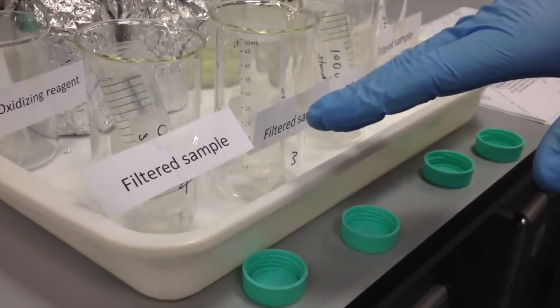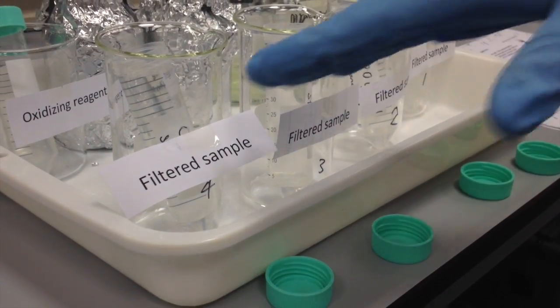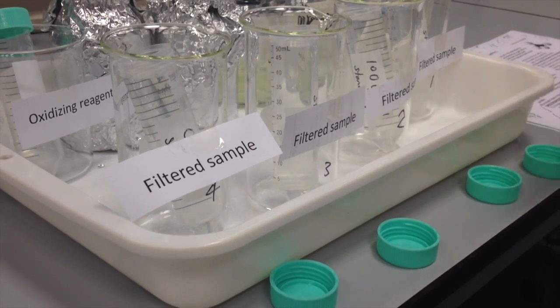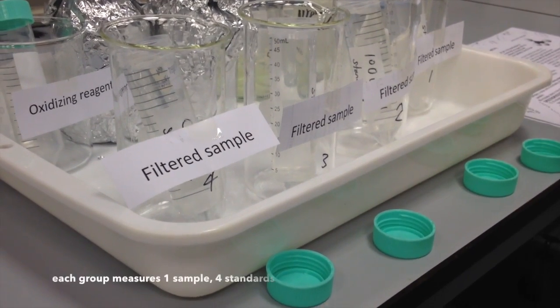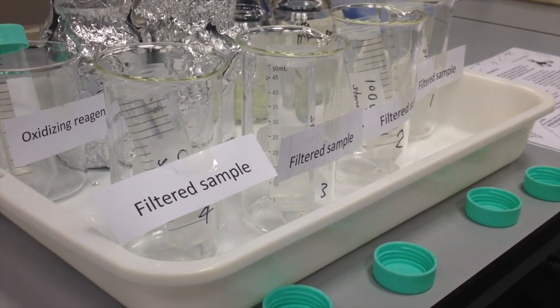And right here in the front I have beakers that are filled with what for you will be your filtered samples, but for today I'm using the standards that we use in the standard curve in place of the samples. So right now I'm just constructing the standard curve to instruct you how to do this process.